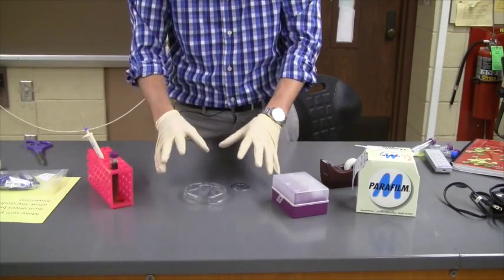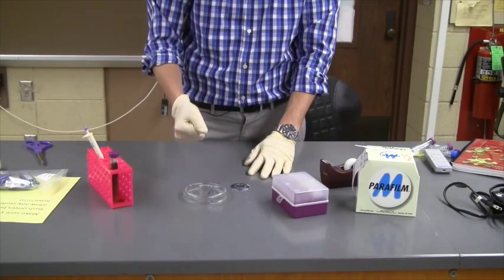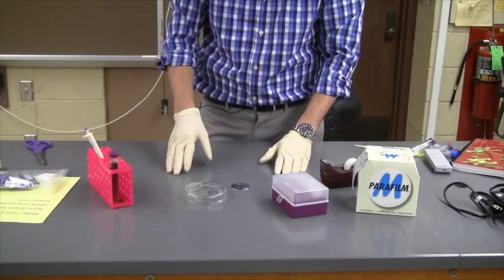Let it sit for a little while to let that bacteria solution soak in. Then lastly, you can add your antibiotic discs or whatever treatment you're going to add.